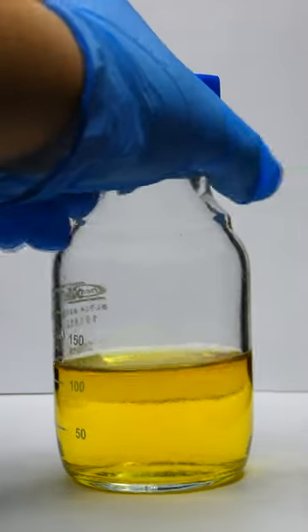Here's a bottle filled with a warm yellow liquid, and when I shake it, it turns red. And if I shake it even more, it turns green.